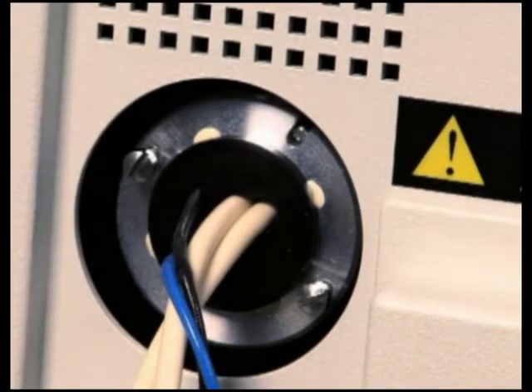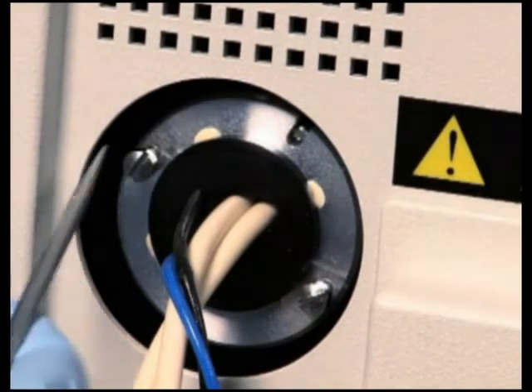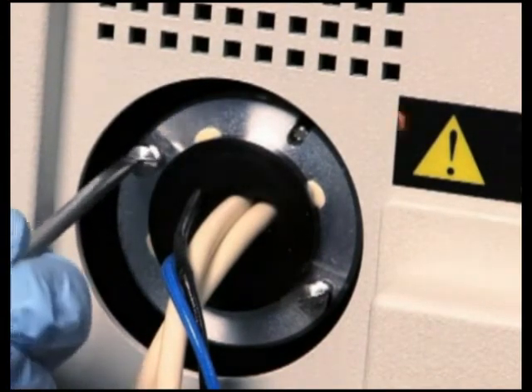Ensure that it is flush with the optics bench. Secure it into place by alternately tightening the captive screws.